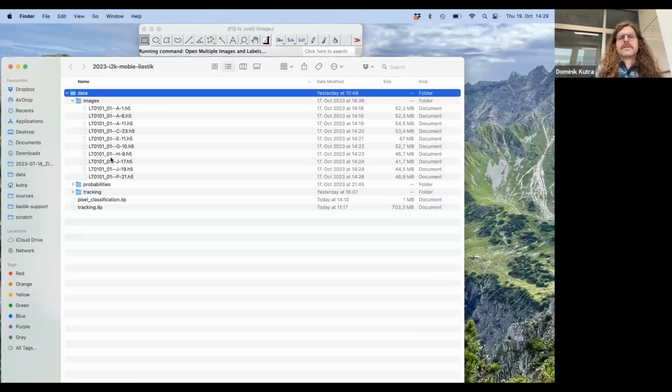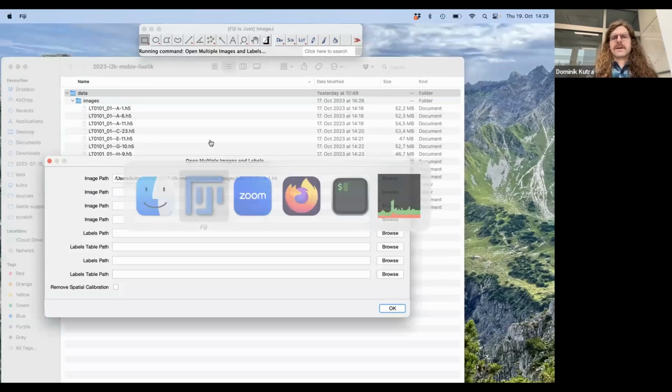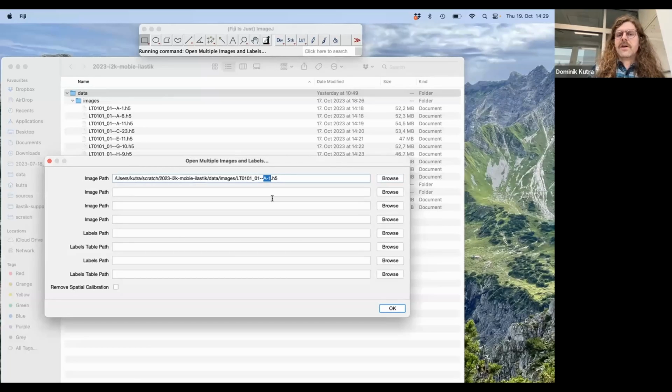You see, they all have a common prefix, which denotes the experiment, and then a position for the screening experiment, and then the file ending H5. What we want to do is capture all of these, not only the first one. This is where the regular expressions I mentioned before come in. Regular expressions are an incredibly complex and very powerful thing, so there's no way I can explain a lot about this right now, but the only thing to remember is that you can add a dot and a star, and together these two symbols will match everything that comes in between. So no matter whether I have this A1 or this A6, they will all be matched and loaded into MoBIE.